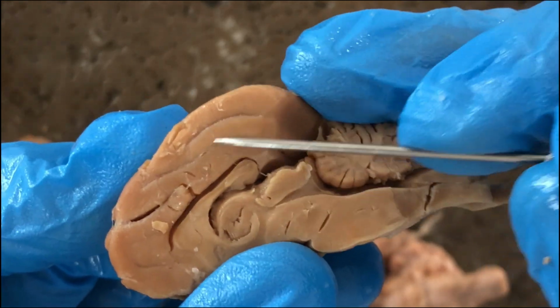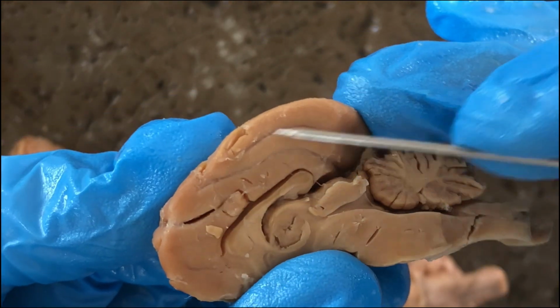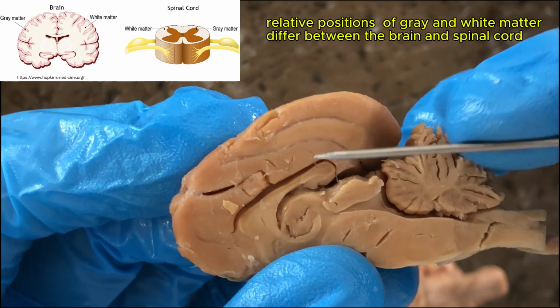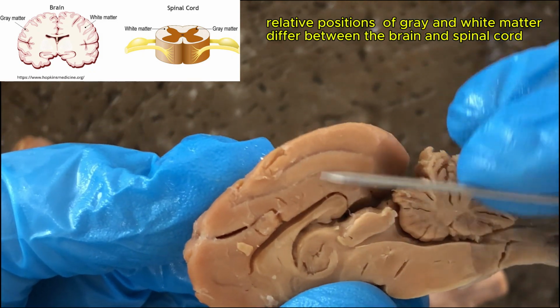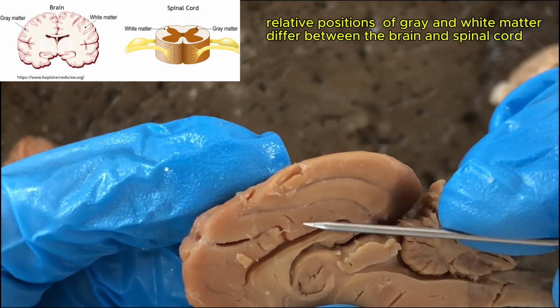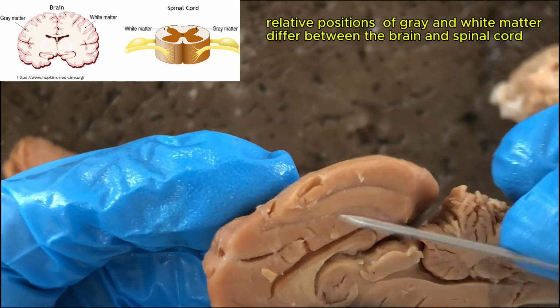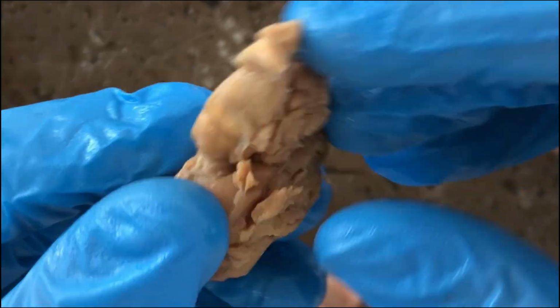So the cell bodies would be more concentrated in the gray matter areas, whereas the white matter is white because they contain the axons, which are covered by a fatty layer of myelin sheath. That's why they're white, because of all of the fat. So gray matter, cell bodies; white matter, axons covered by myelin sheath.